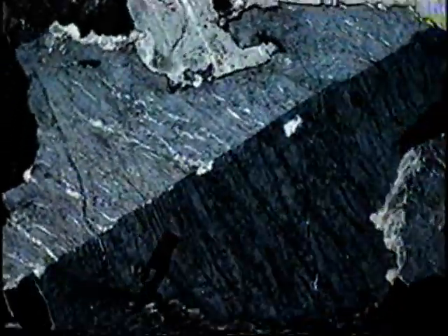Probably the commonest alkali feldspar, orthoclase has low birefringence, low relief, right angle cleavage, and may show simple twins. It's commonly cloudy and heterogeneous due to exsolution.